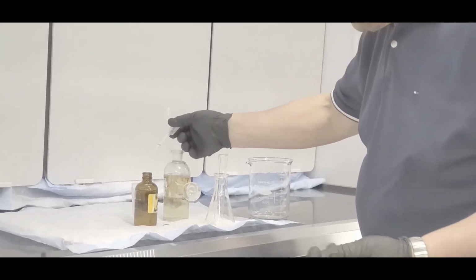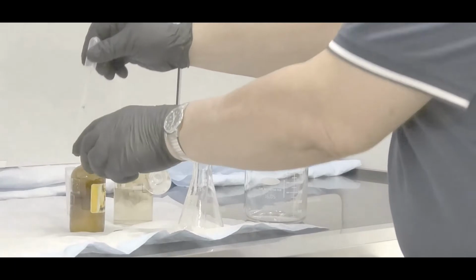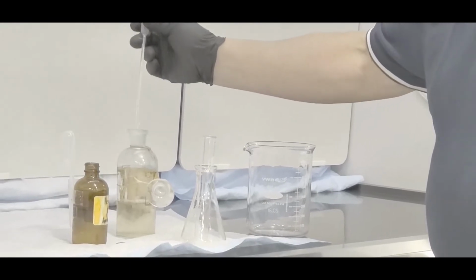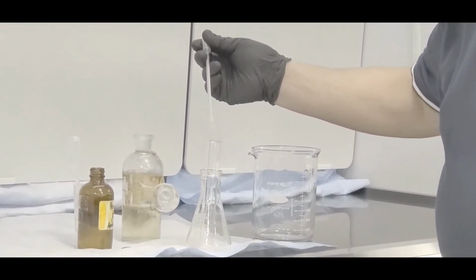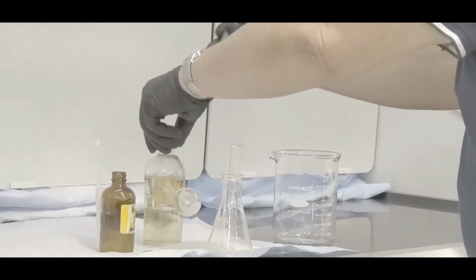So what you then do is go to a test tube, squirt that in there. Okay, next thing, you need the phosphoric acid. So squeeze, and you only need about 2 or 3 drops in there. So in that case, 1, 2, 3, 4. Okay, it's good enough. Okay, let's get that in there.